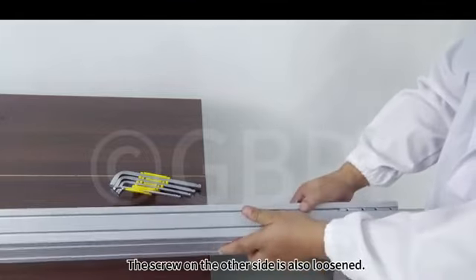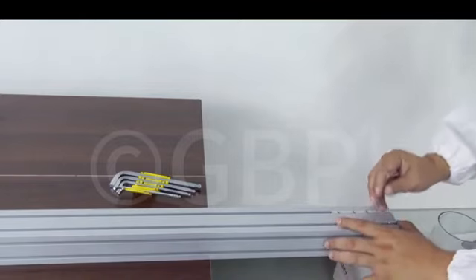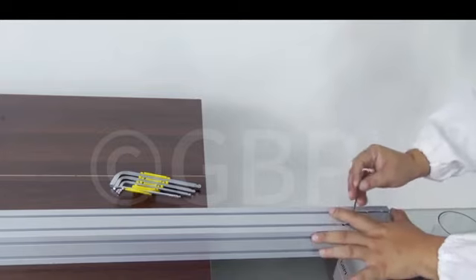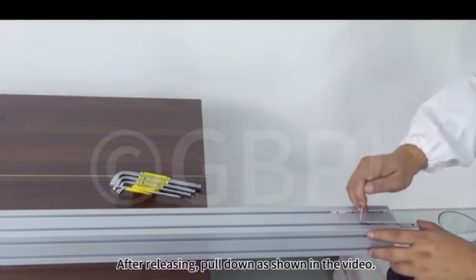The screw on the other side is also loosened. After releasing, pull down as shown in the video.